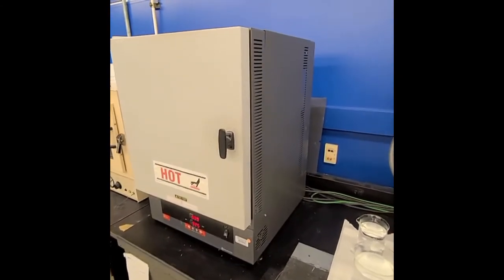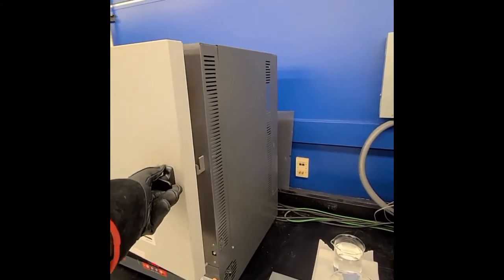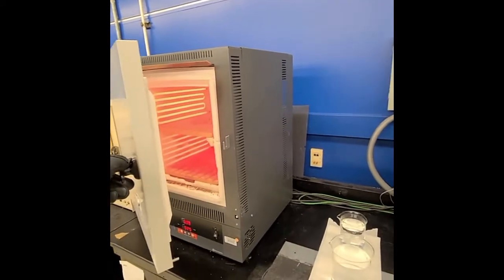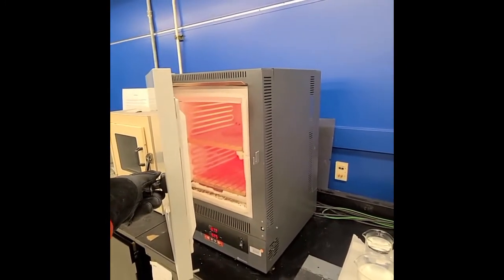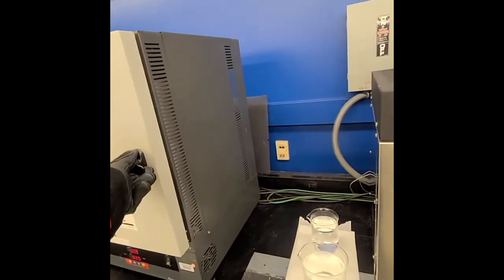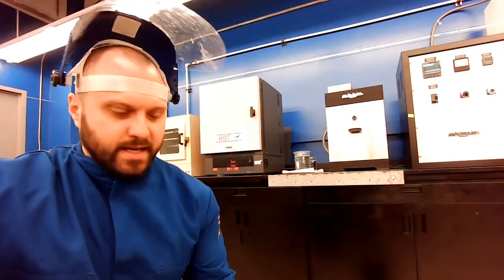It's at about 900 degrees C. I just want to open this up. I'm going to be very careful just to show you it's very hot in there. It's glowing red. Those samples are white hot, so we're going to be very careful when we take those out and quench those. All right, so we're ready to take the first sample out.